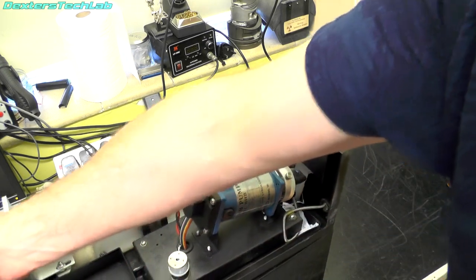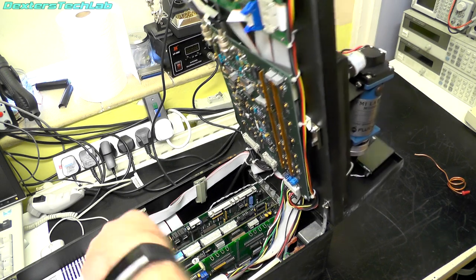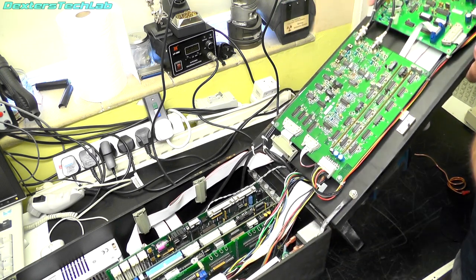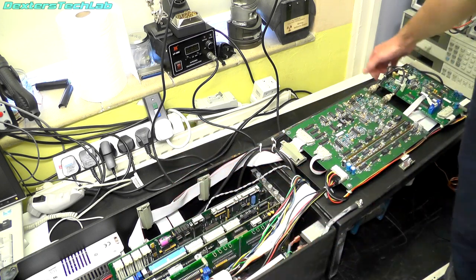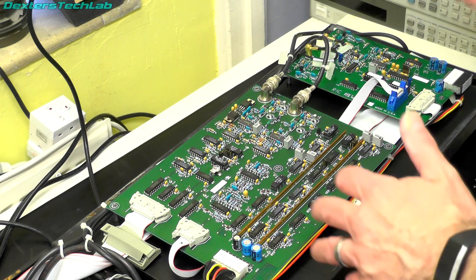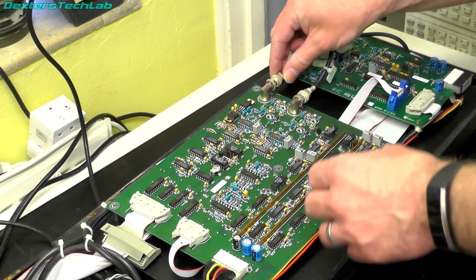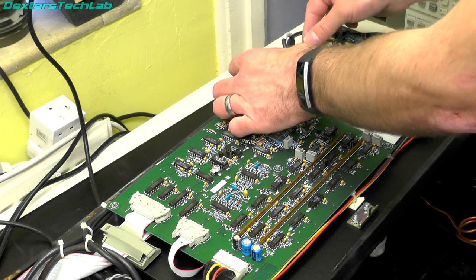In the base of this machine — I'm going to open this up, it's not really meant to fold out like this, there's actually a stand — but for the purposes of this video I'm going to open it all the way up. On the underside of the sensor table we have the connections coming in from the photo multipliers: two BNCs on a large coax and two smaller ones.